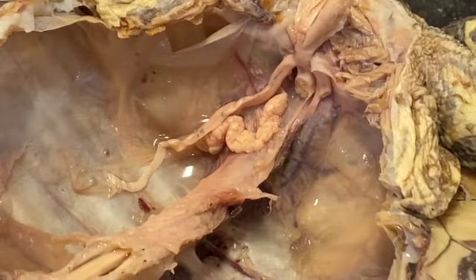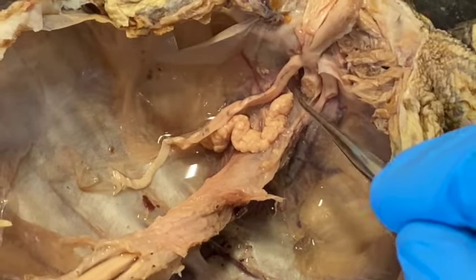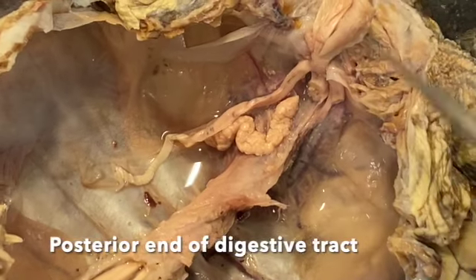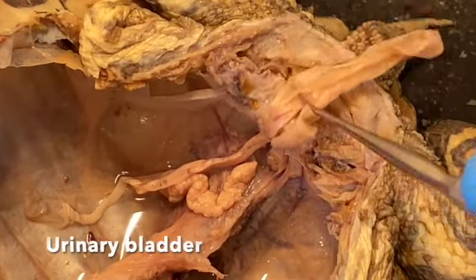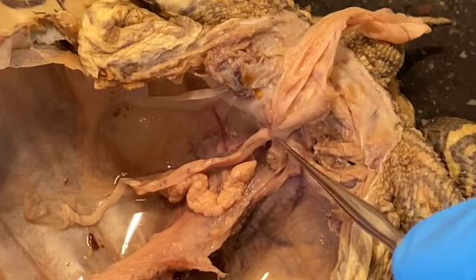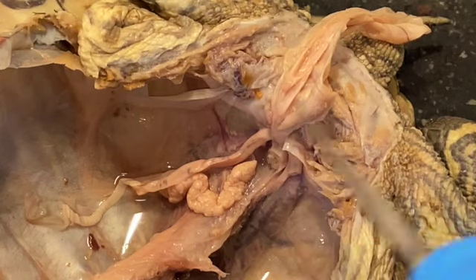So here are some things that I want to point out. This structure right here is the posterior end of the digestive tract. And this structure is the urinary bladder. And if you notice, the urinary bladder empties into the digestive tract right here.